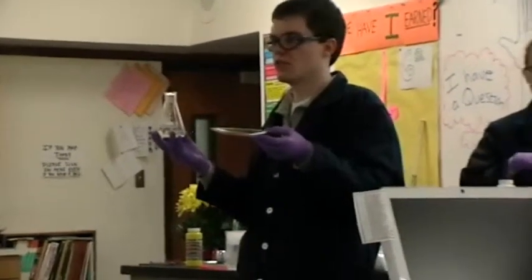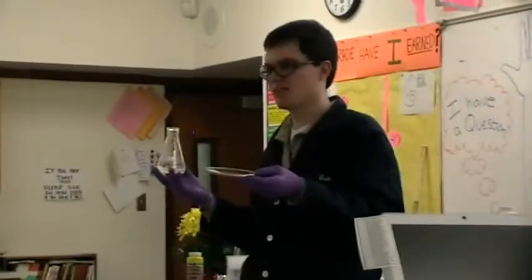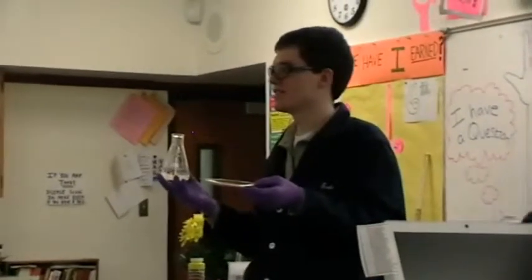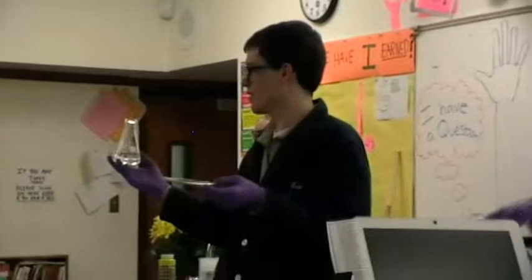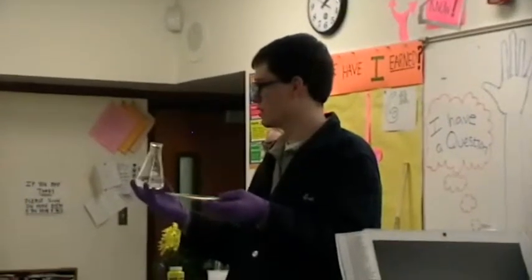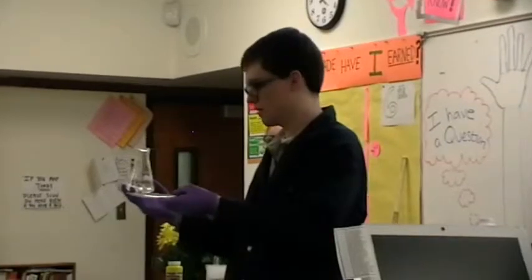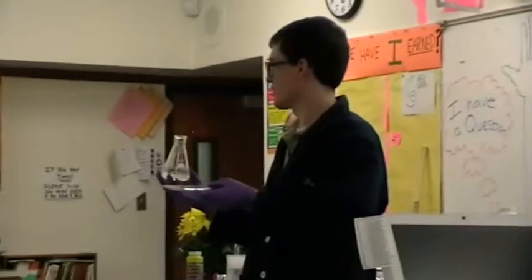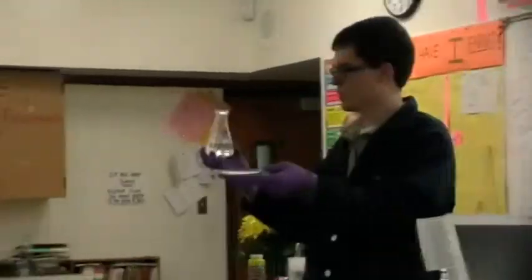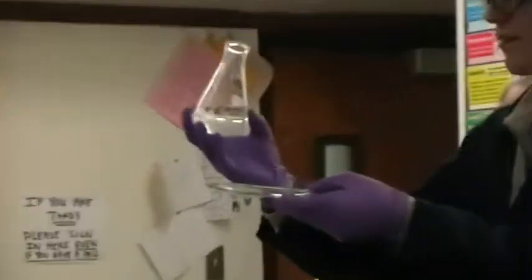For those of you who said yes, in case it doesn't, can I get a volunteer to maybe clean up the mess if it doesn't? You're going to be running all the time. Hopefully it'll all fit on the plate. You have confidence it will, right? It'll all fit on the plate. I told you so. Alright, so we're just going to pour this, and if it spills, you're going to mop, right?